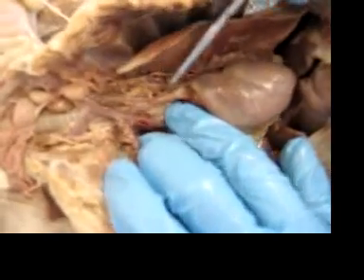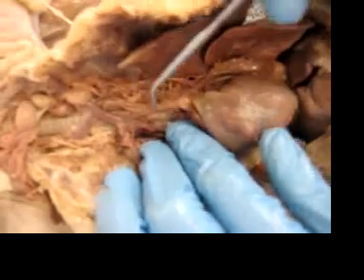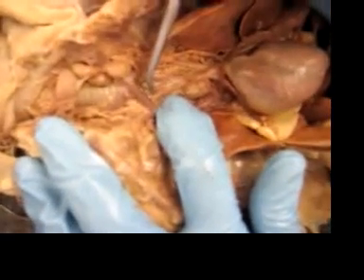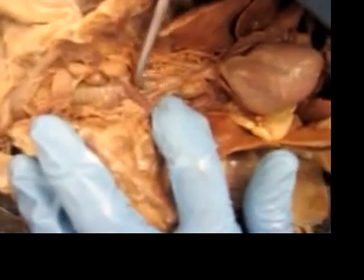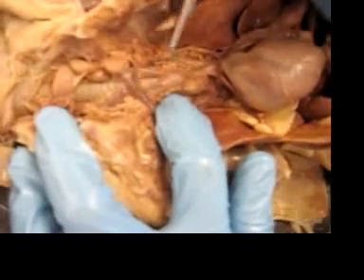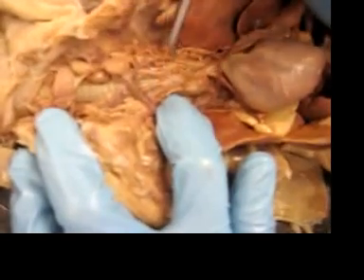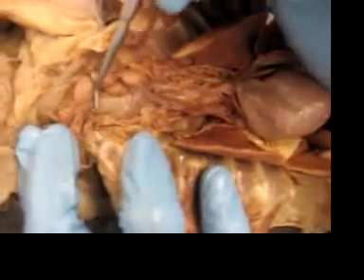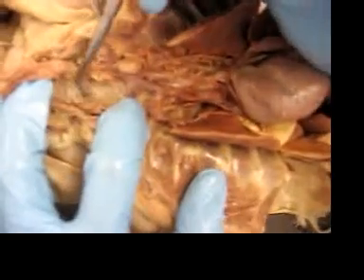Here's the left subclavian right there, and then the left common carotid artery, the right common carotid artery, and then the right subclavian. So you have the subclavians and the carotid arteries. And the trachea.